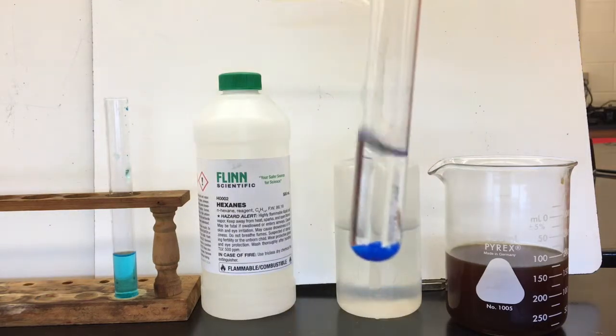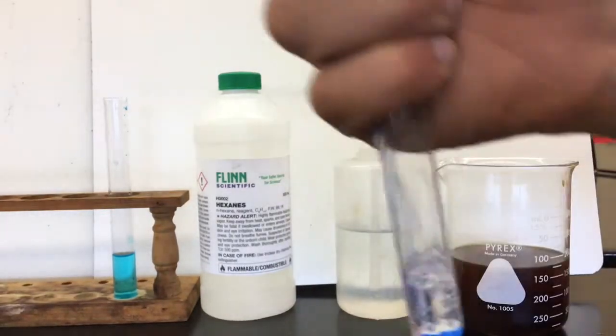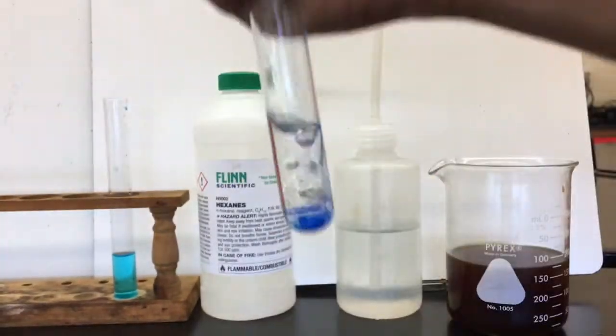Well, let's check the situation with our hexanes. Looks like a pretty clear liquid so far, but we'll give it some mixing like we did with the water.